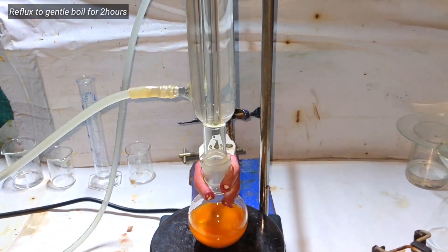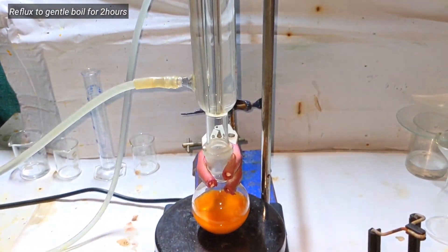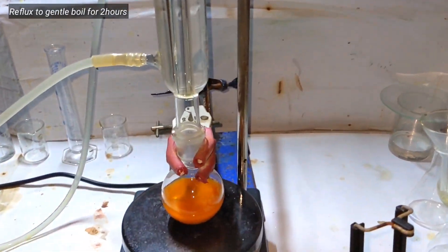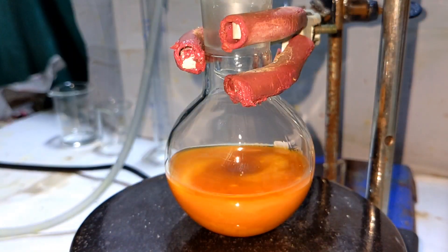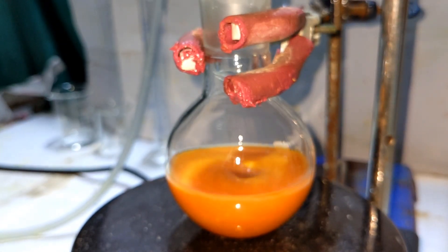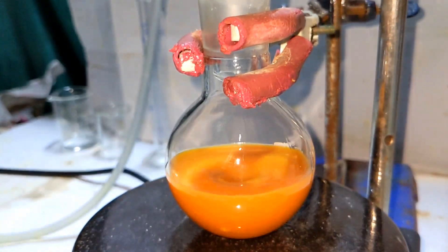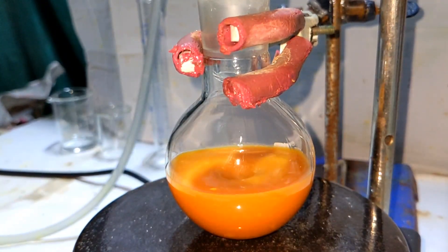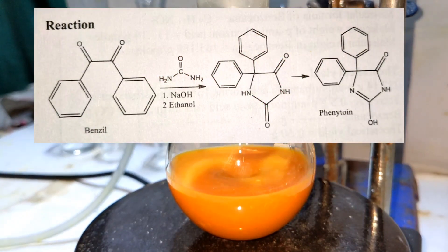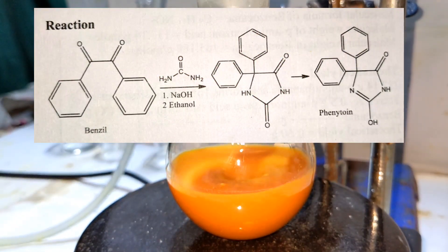A reflux condenser was attached on top and the mixture was refluxed by gently boiling for two hours. Let us see what is happening now — this is the overall reaction that is taking place.